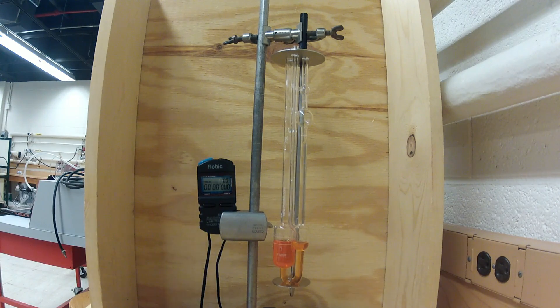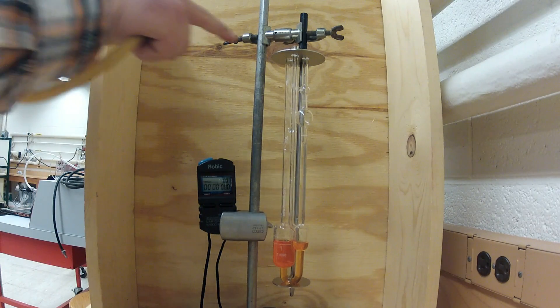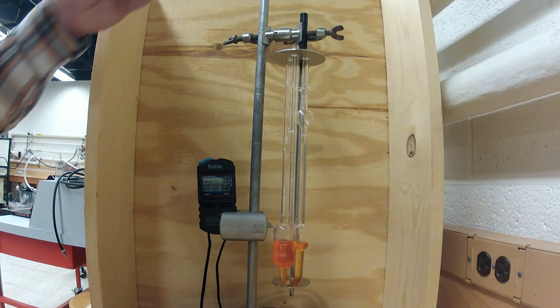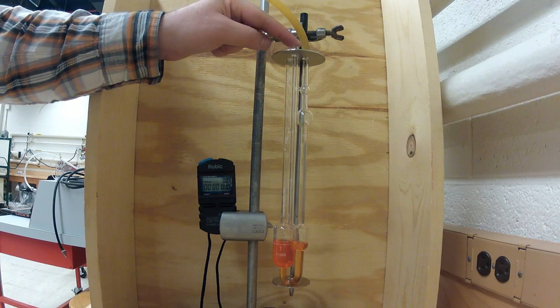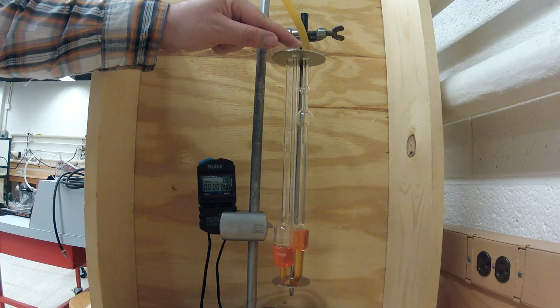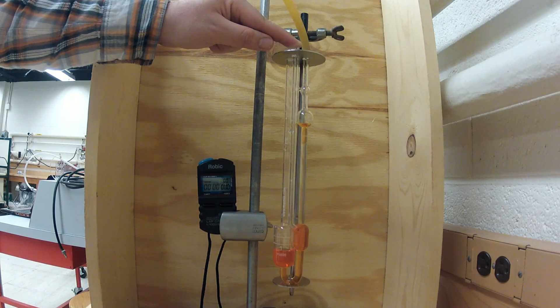You will then use a syringe and surgical hose apparatus as shown here to create a slight vacuum within the viscometer to draw the fluid. You will connect the open end of the hose to tube 2 of the viscometer, as seen in figure 1 as well as in the video. You want to ensure that the end of the tube has a vacuum-tight seal on the viscometer so no vacuum can escape.